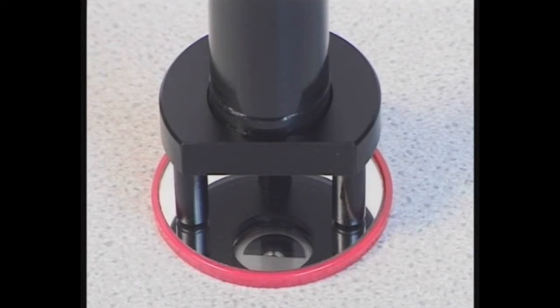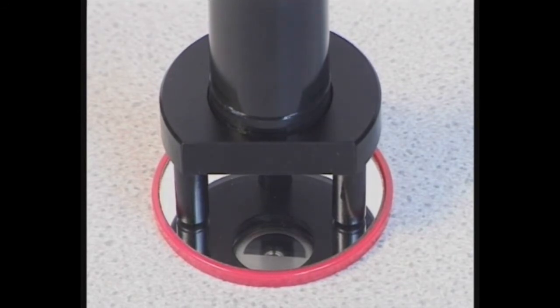Repeat this process until the readings stabilize. This is typically three to five times for a standard lube oil. Record the average time.